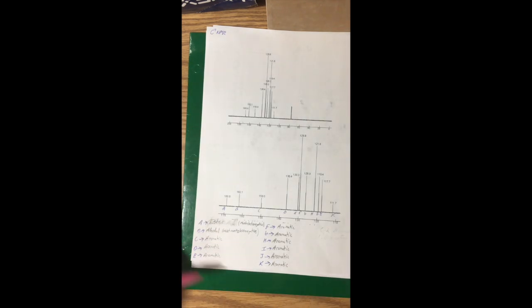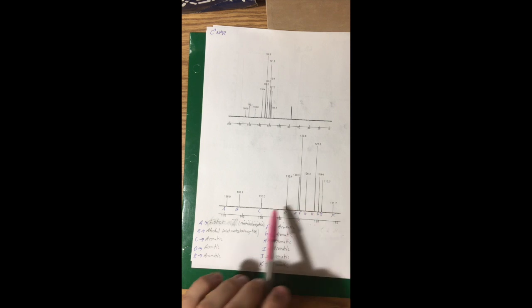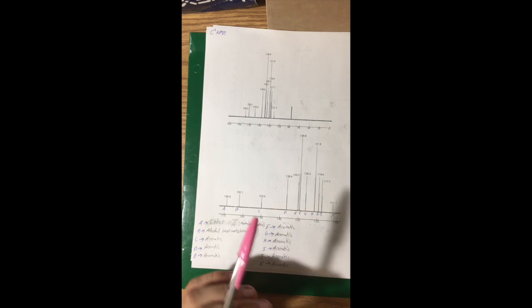And then C through K is all aromatics, but C is next at 150 due to it touching, this carbon here touching part of the ester. So as we go D through K, all here, these signify aromatic. Just kind of depends on it. Most of them went over here due to the effect of the oxygens, and this one was kind of untouched, is why you see the letters that are farther down in the alphabet.